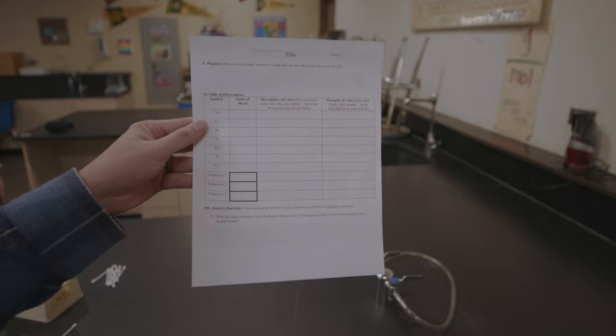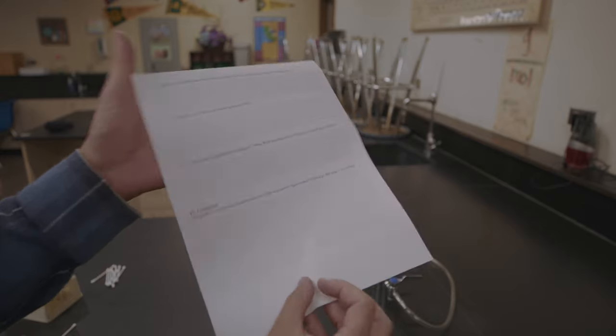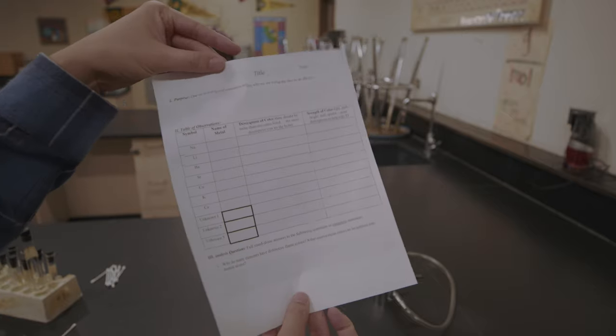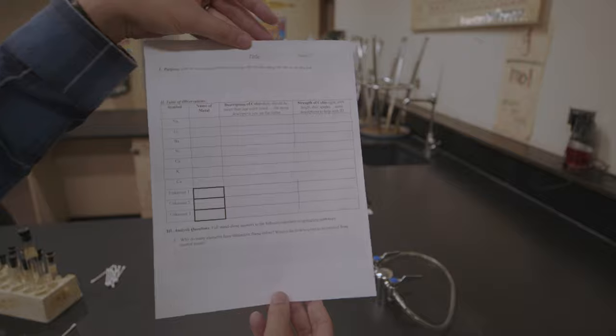Based on qualitative and quantitative analysis, remember as you're doing this lab today, think about the purpose and what we're trying to learn. Use lots of good qualitative data and great descriptive words. I don't want to just hear that the flame color is red — tell me if it's a nice bright red-orange, if there are some sparks in there. What does it look like to you? Have some fun, be descriptive, and write down lots of good data. This is sodium.